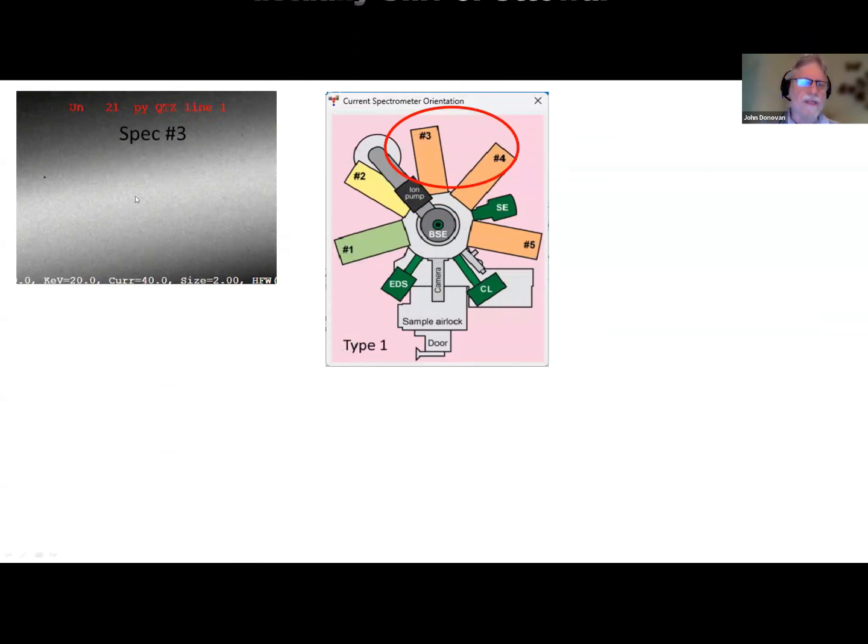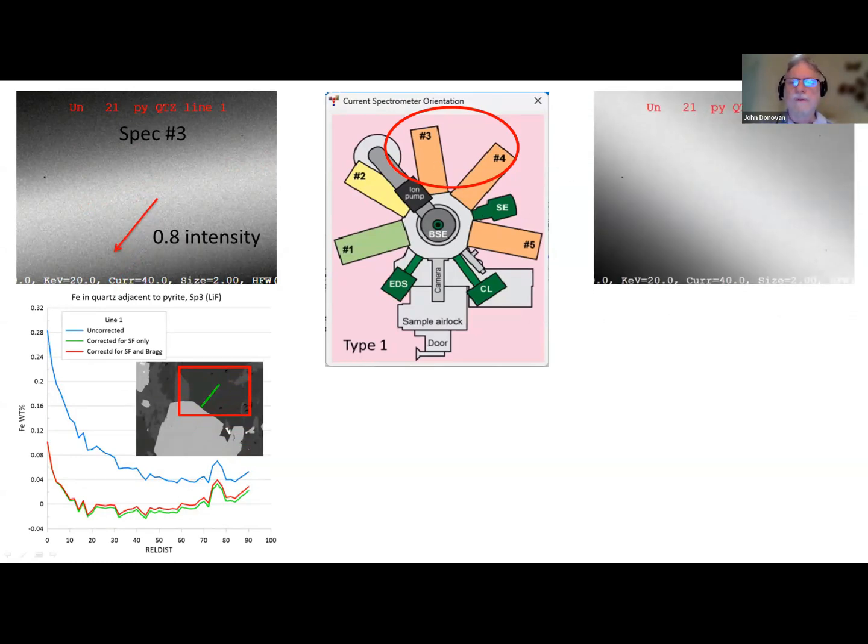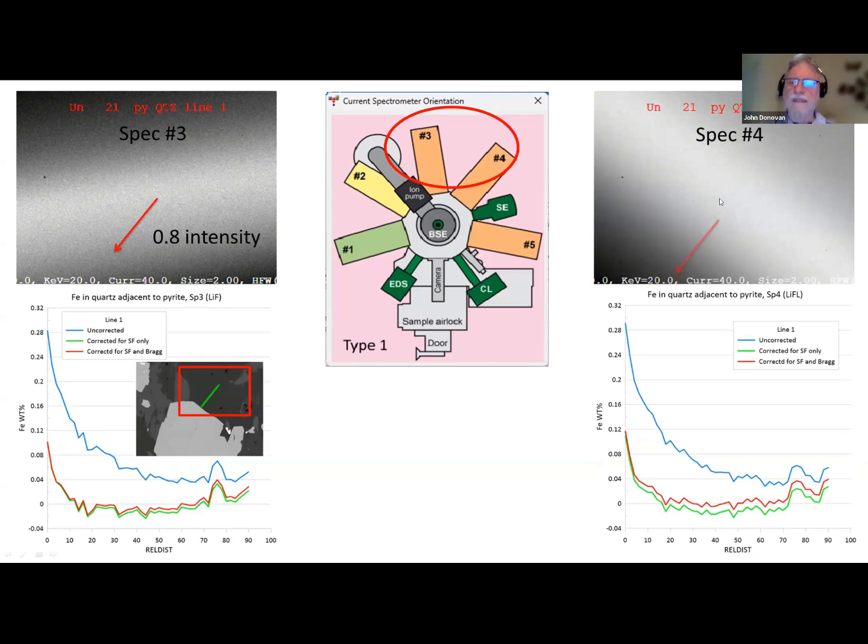So here this is spectrometer 3, and you can see the Bragg defocus effects here. Here is the corrected and uncorrected data, the uncorrected data is blue here, and the corrected data here. You can notice that the Bragg correction is very small, minimal, because we're essentially moving in the same direction as the defocus, not perfectly, but roughly. In fact, it's about a 20% correction, so it's a small correction. But spectrometer 4 is a little bit different. Here now is spectrometer 4, and the boundary is moving away from our analysis point in the same direction, but it's about a 40% correction, and you can see that there's a larger Bragg defocus correction there.